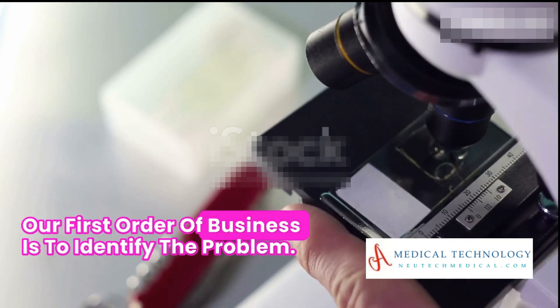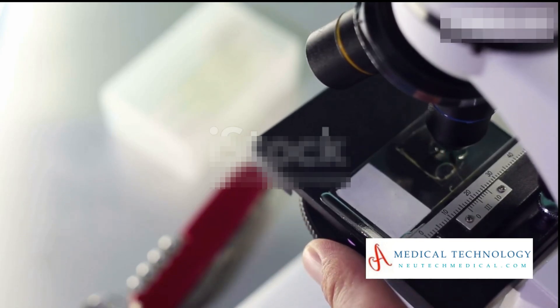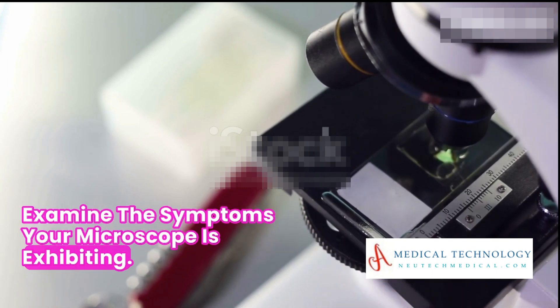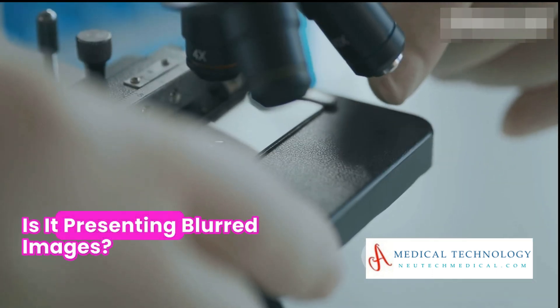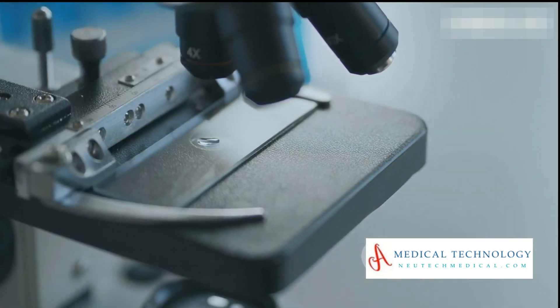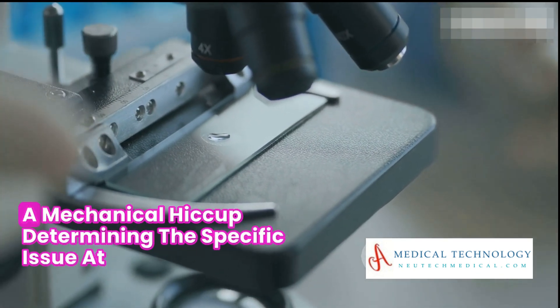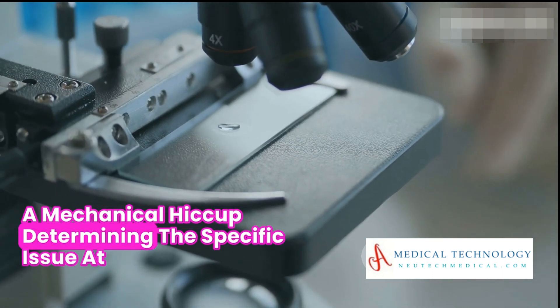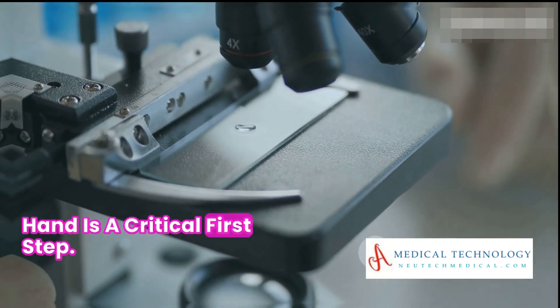Our first order of business is to identify the problem. Examine the symptoms your microscope is exhibiting. Is it presenting blurred images? Is the focus distorted? Perhaps there's an issue with the lighting or a mechanical hiccup. Determining the specific issue at hand is a critical first step.